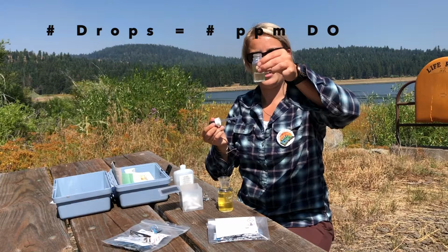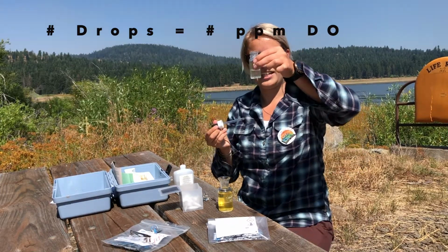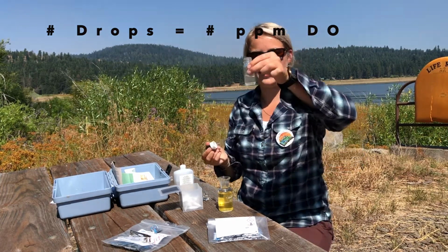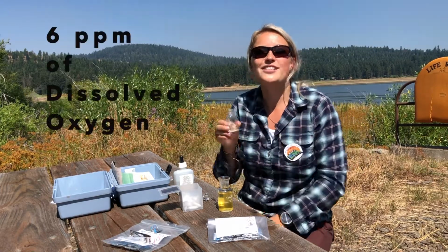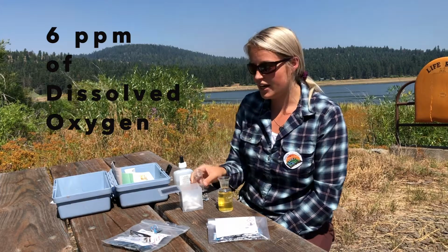4. Oh, it's getting there. 5. It's almost clear. And 6. Now it is clear. So that means there is 6 parts per million of dissolved oxygen in Hyatt Lake.